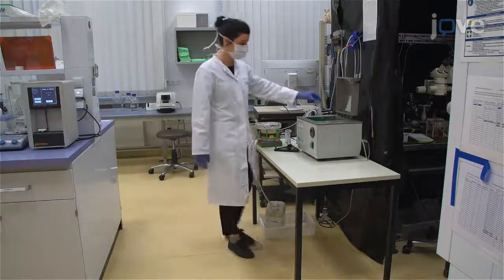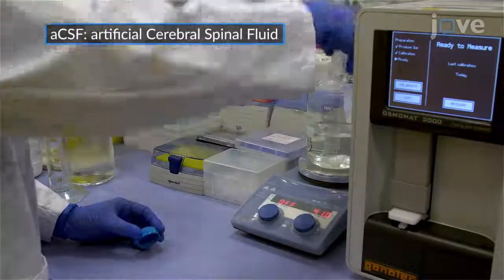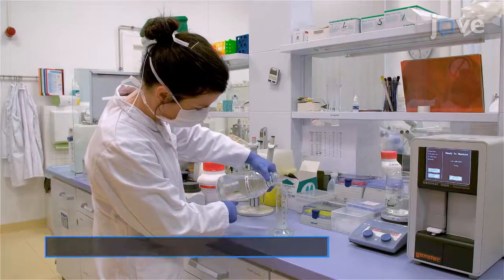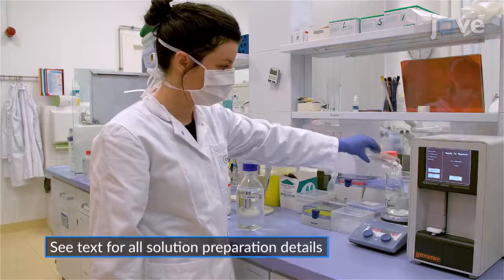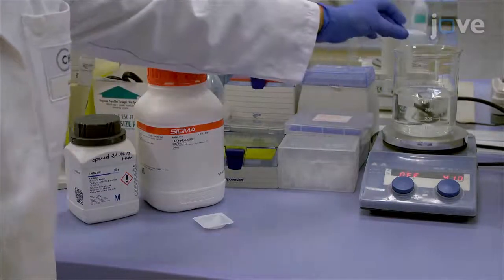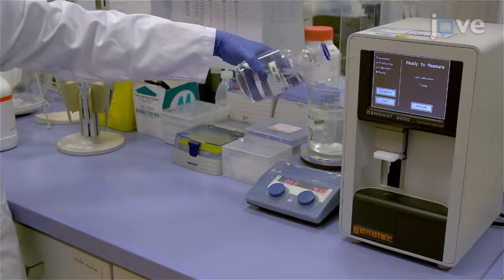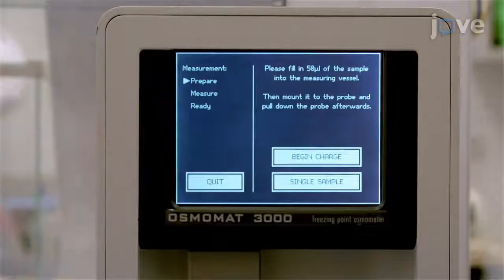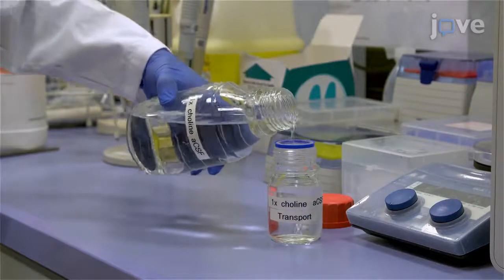On the day of the procedure, or as late as possible on the day before, thaw 50 mL of a 10X Choline ACSF solution in a 37°C water bath and add the thawed solution and 50 mL of 10X solution 2 to approximately 300 mL of double distilled water. Add final concentrations of glucose and calcium chloride to the mixture and stir until dissolved. Then add double distilled water to a final volume of 500 mL, measure the osmolarity, and fill a bottle with approximately 100 mL of the 1X Choline ACSF.